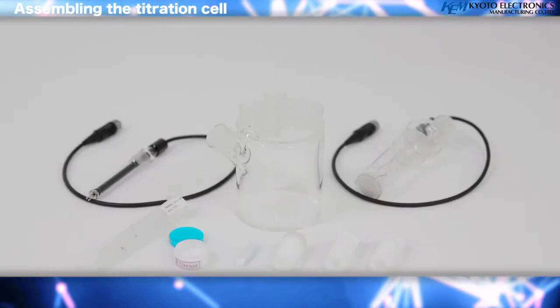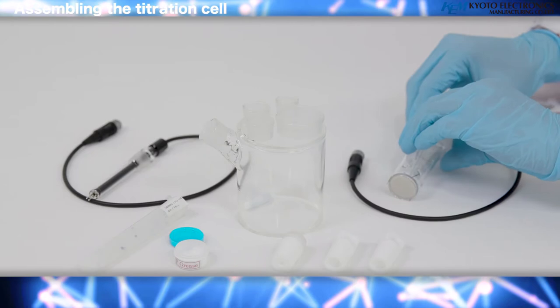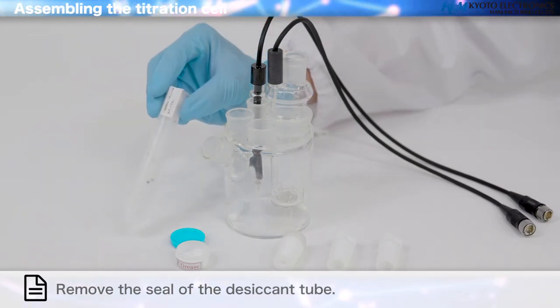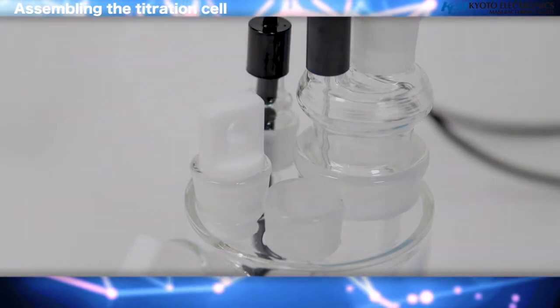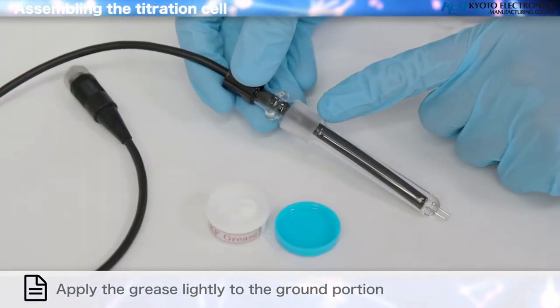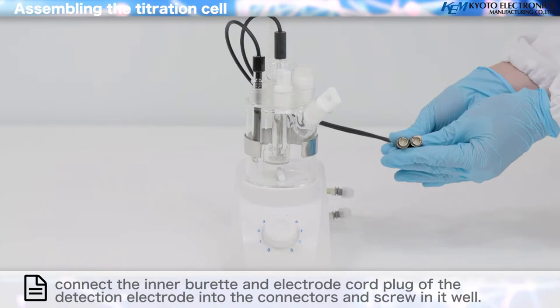Assembling the titration cell: put the stirrer rotor in the titration cell and attach the components of each part. Install the inner buret, along with the port plug, syringe inlet port plug. Apply the grease lightly to the ground portion. Set the titration cell in the titration cell holder of the stirrer. Connect the inner buret and electrode cord plug of the detection electrode into the connectors and screw it in well.